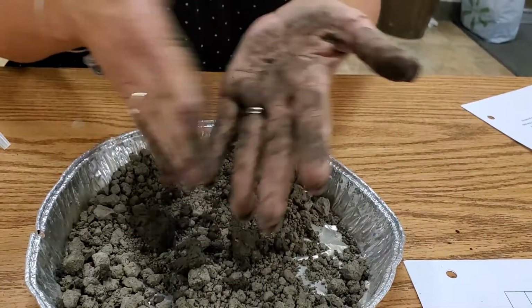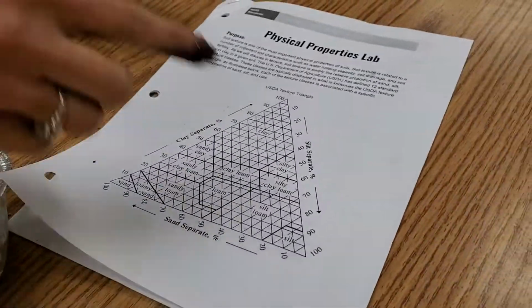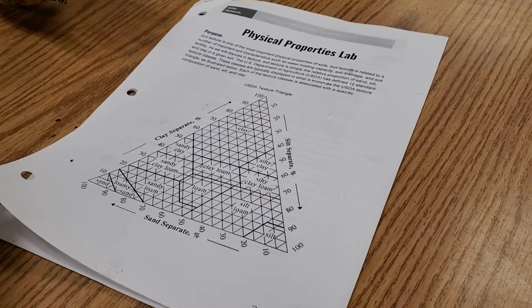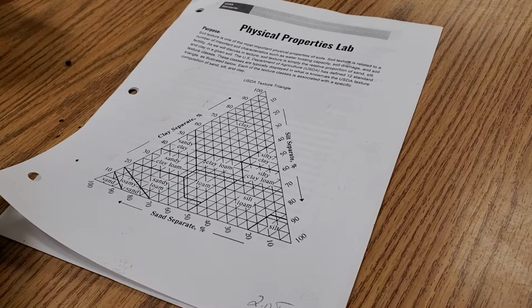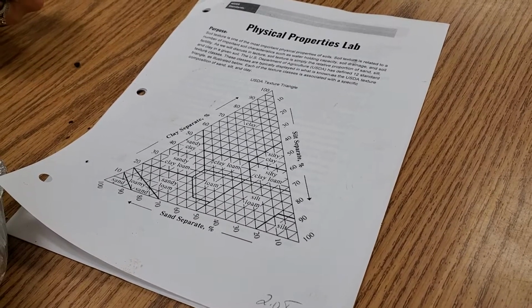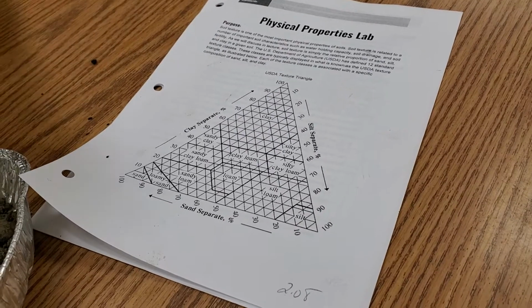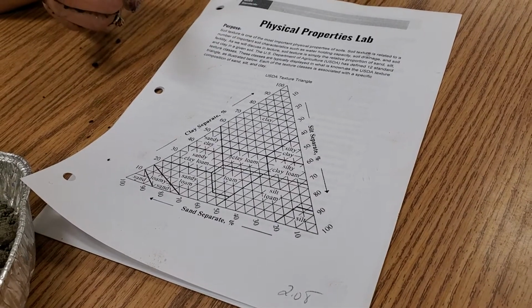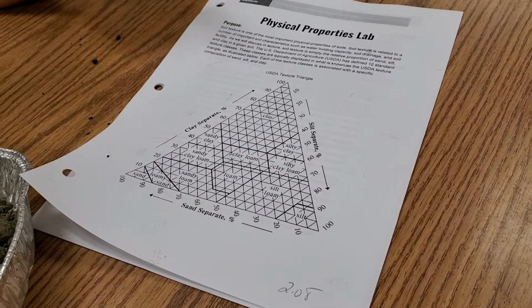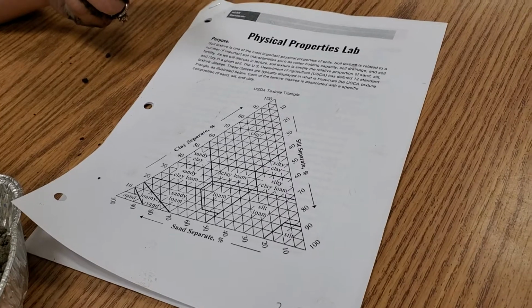So you're going to record that here for number 3 on your chart. You're going to use the soil triangle to decipher the percentage of the soil. Just go to the middle of that specific box. You're also going to have a worksheet that has a soil triangle with a whole bunch of examples for you to work through. I'm sure if you had some kind of ag class at some point at school, you've walked through soil triangles like this. And if not, if you have questions, if you need help, if you need me to walk through it with you, I'd be more than willing to. Just go ahead and give me a call.